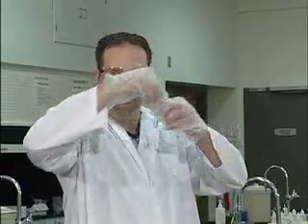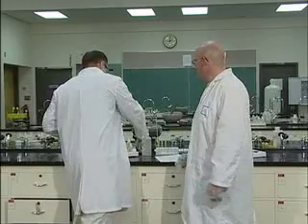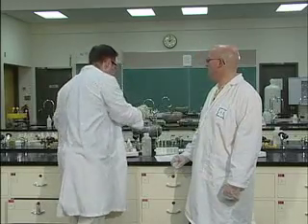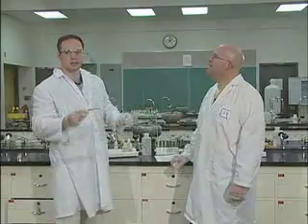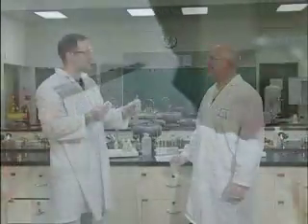6 molar hydrochloric acid, when you mix it with magnesium, reacts violently. So we all get to use a little bit of magnesium. One of the products of magnesium and hydrochloric acid is hydrogen gas, which is very flammable. Be very, very careful. Do not smoke around this experiment. And please hold the test tube away from yourself, okay?